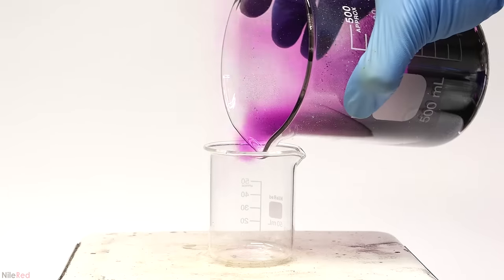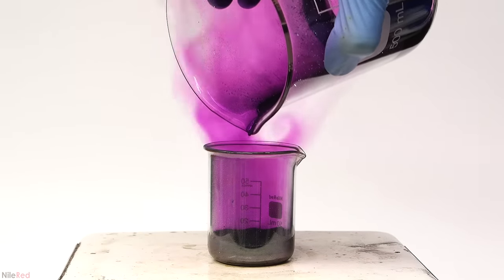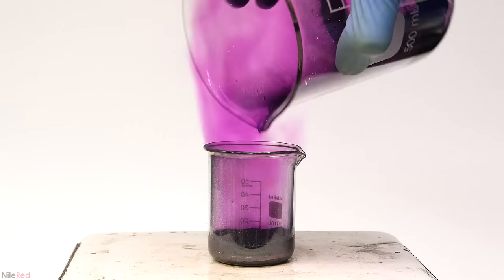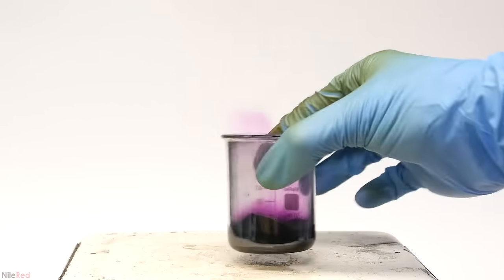Then, while it's a liquid, I pour it into another beaker. If this doesn't prove that iodine melts, then I really don't know what will.